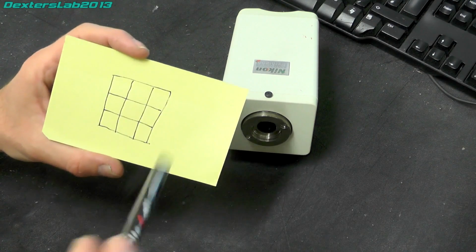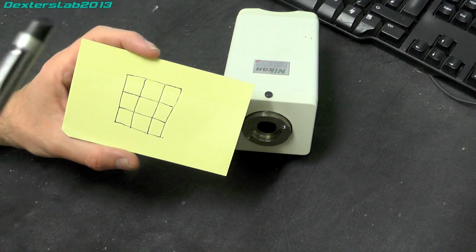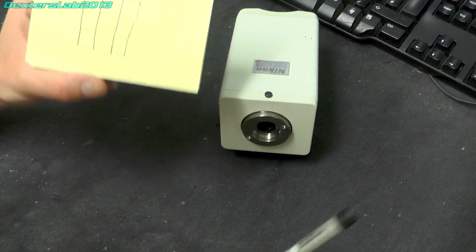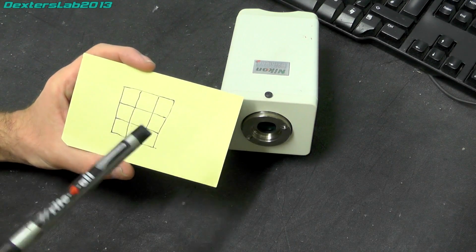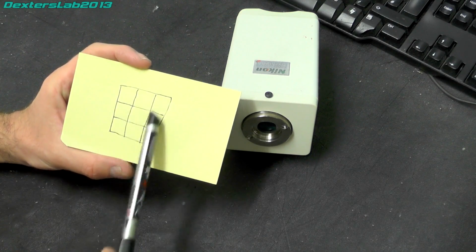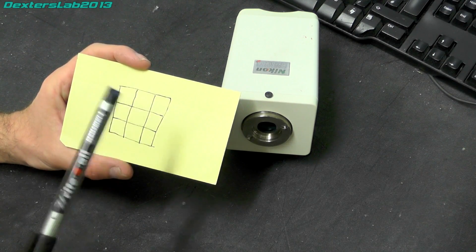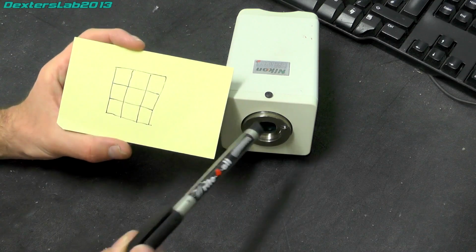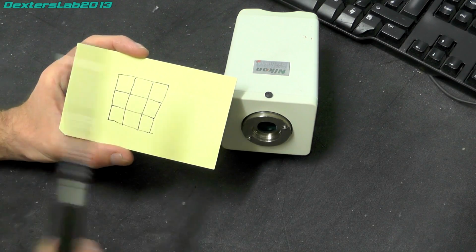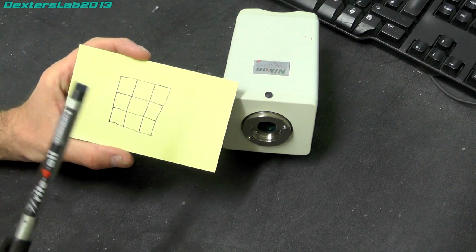So it's quite clever. It'll be interesting to see when we take this apart exactly how they're doing that. There's some talk that it's piezoelectric. I don't know, we'll see when we take it to bits. But if you consider how much this is actually going to be moving, they say it moves by 1/3 of a pixel, which if they're using this arrangement, that's how it's going to be. I've not found any actual pixel size for this CCD, but it's going to be small microns, so moving a third of the pixel is going to be a tiny, tiny movement. There's no way you'd ever be able to see it.